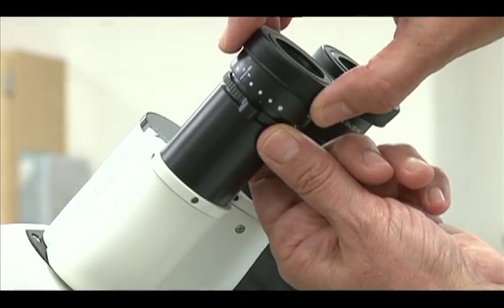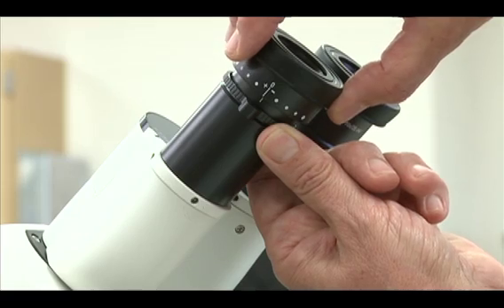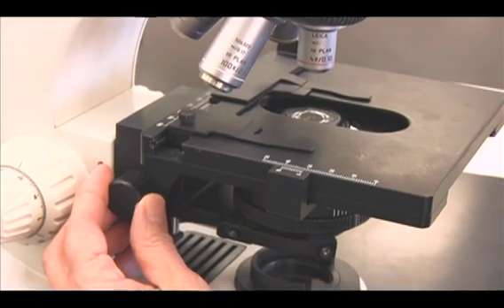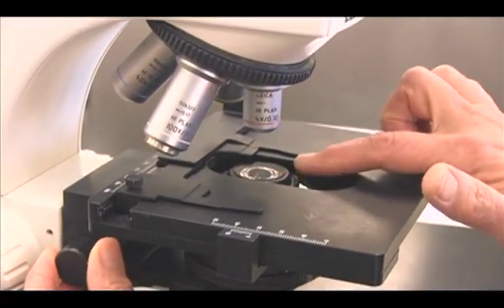Set the focusing ocular to zero. The condenser should be set even with the mechanical stage.